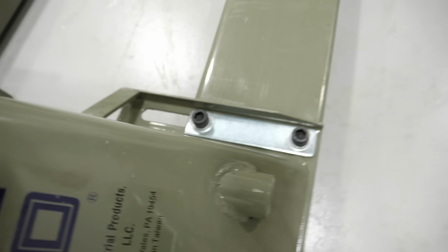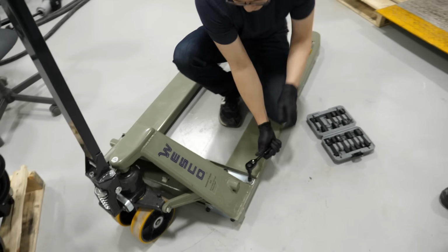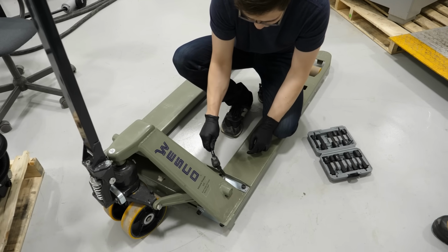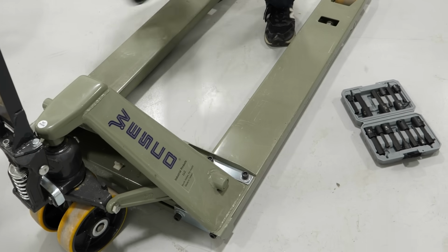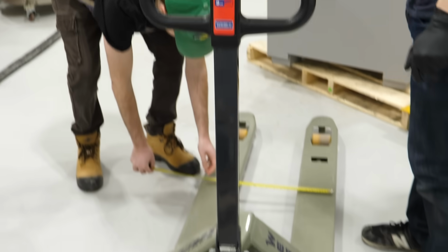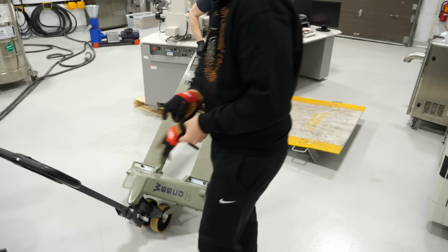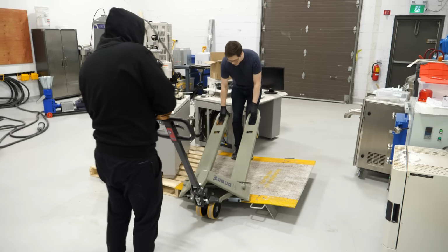It looks like it's an Allen key type wrench. Yeah. Oh, I was right. Damn. My brain is apparently good at judging socket sizes. Should be able to just slide it. Yeah. 21? 21! Theoretically, it should fit. Good luck! Now you have the head. Oh, I did it.